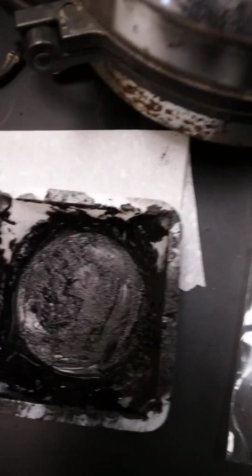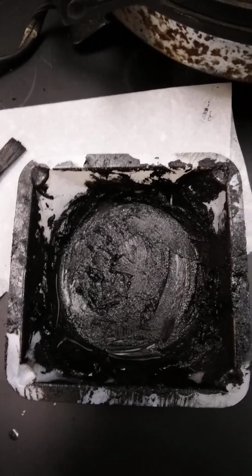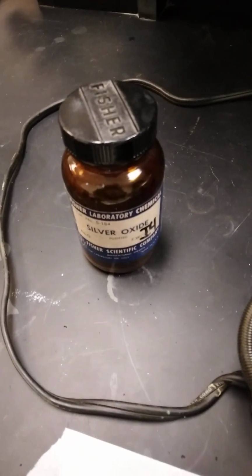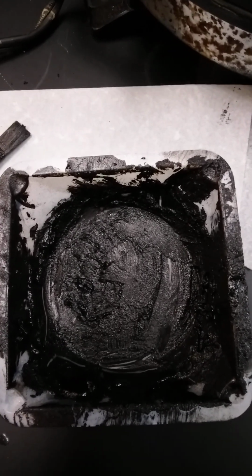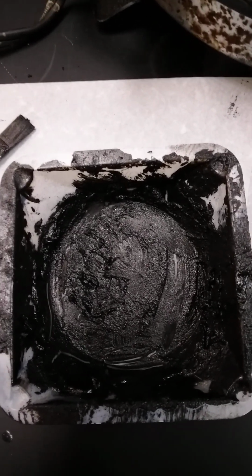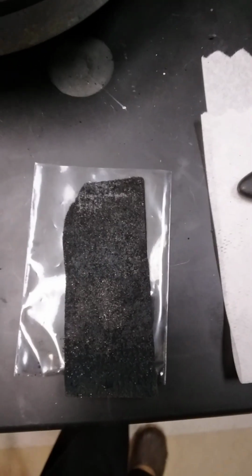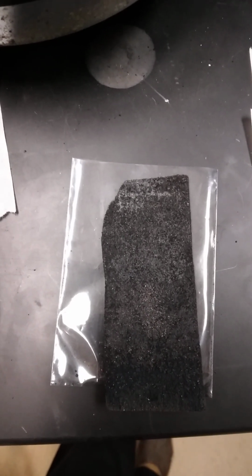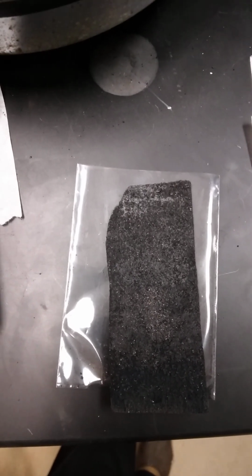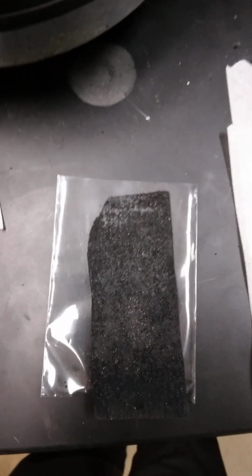Now for electrolysis, we have two of these graphite pads treated with the paste, but we've included some silver(I) oxide in order to get any type of decent water electrolysis. Right before we use the pads, I take these up and do pyrolysis at about 550 Celsius for about 2 or 3 hours, approaching that temperature very slowly over time.